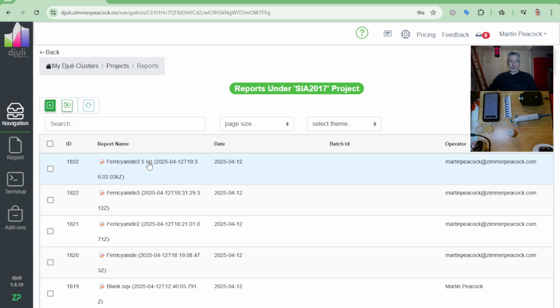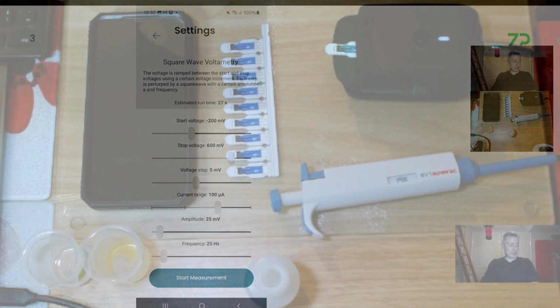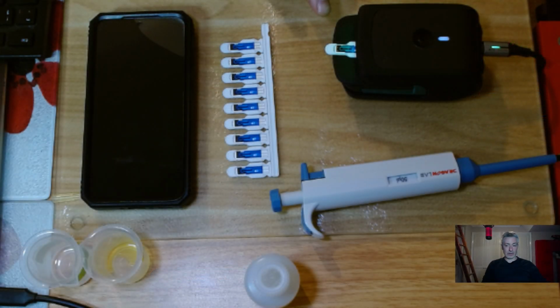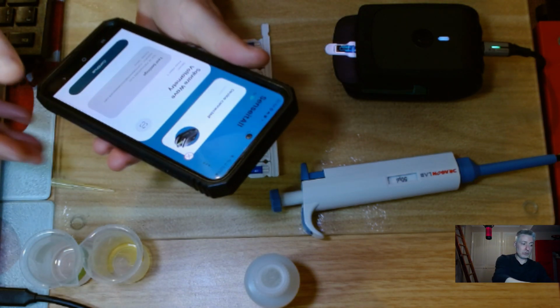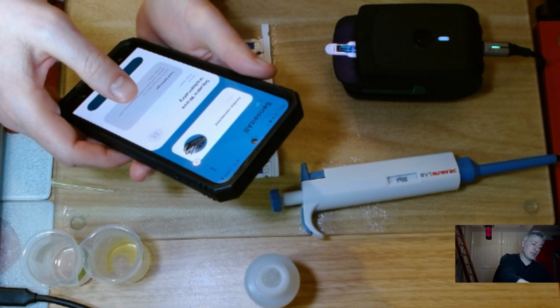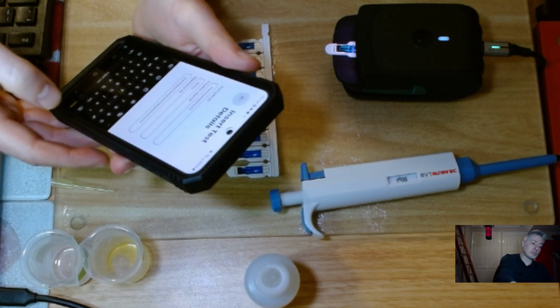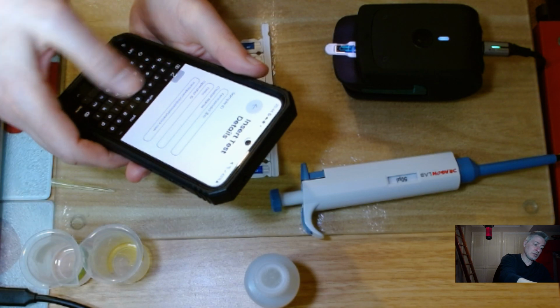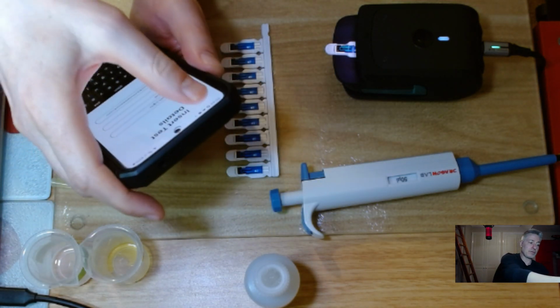Bear with me for a second. I'm going to go to my setup in front of me. I've got a 5 millimolar solution of ferricyanide on there. I've got my app here. I just need to turn this on, and I'm going to do a quick settings check. I've done a 5 hertz experiment, but I didn't want to make you sit through it because it doesn't make for a very interesting video. I'm just going to do a 25 hertz experiment now.